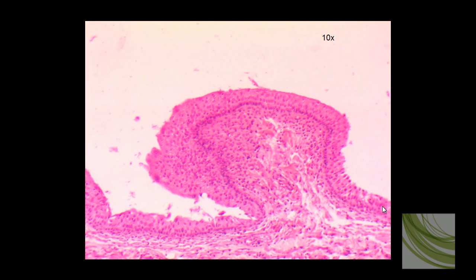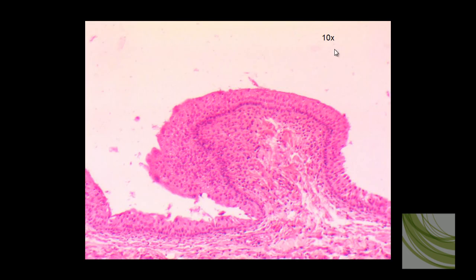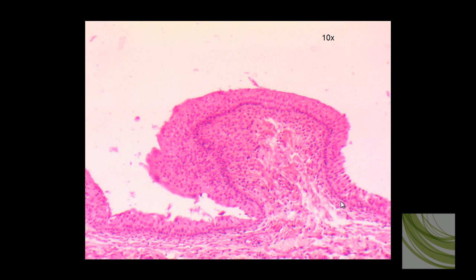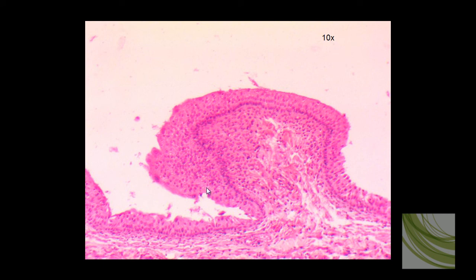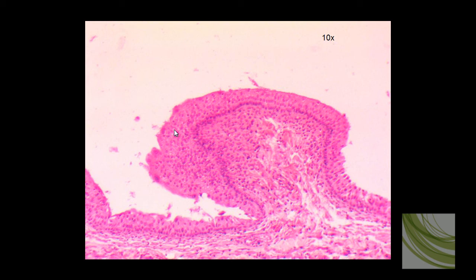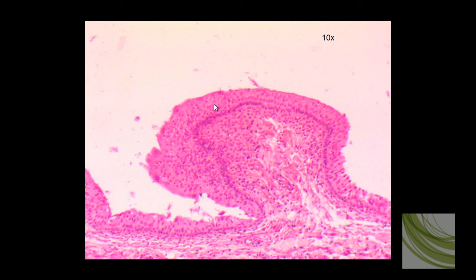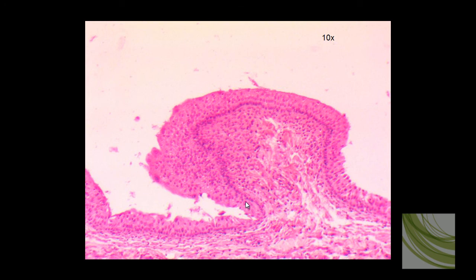Here is that same slide at the 10X objective, and we can see this band of transitional epithelial tissue. We can see the nuclei of all these multilayered cells.